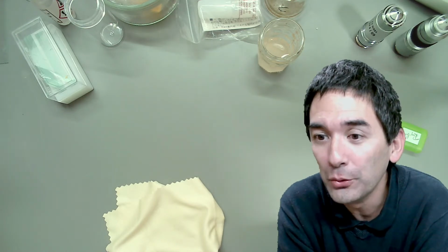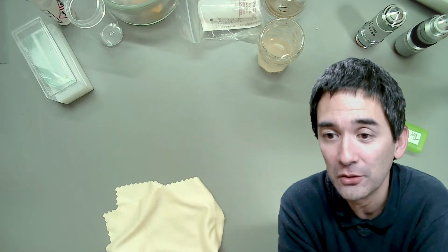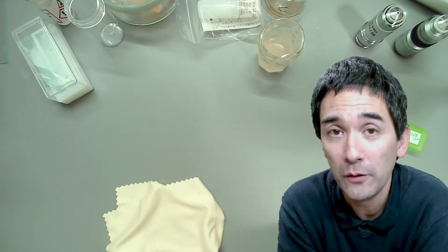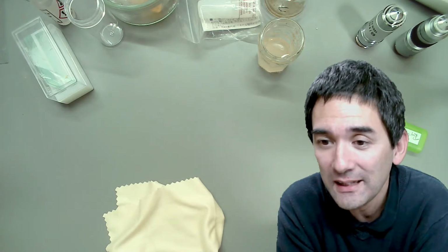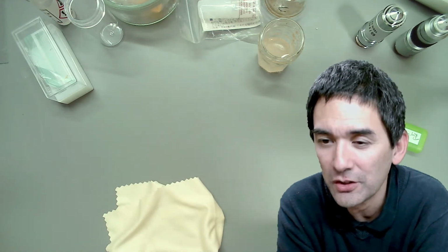Don't clean the lenses with acetone. Absolutely correct, because acetone might actually dissolve some of the lens kits, the glue. Yeah. Pond water is also very interesting. Yes, I also have done this.